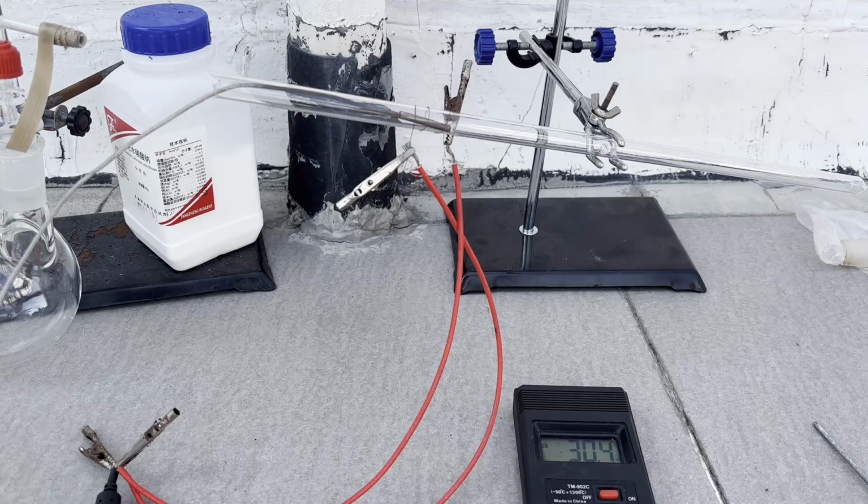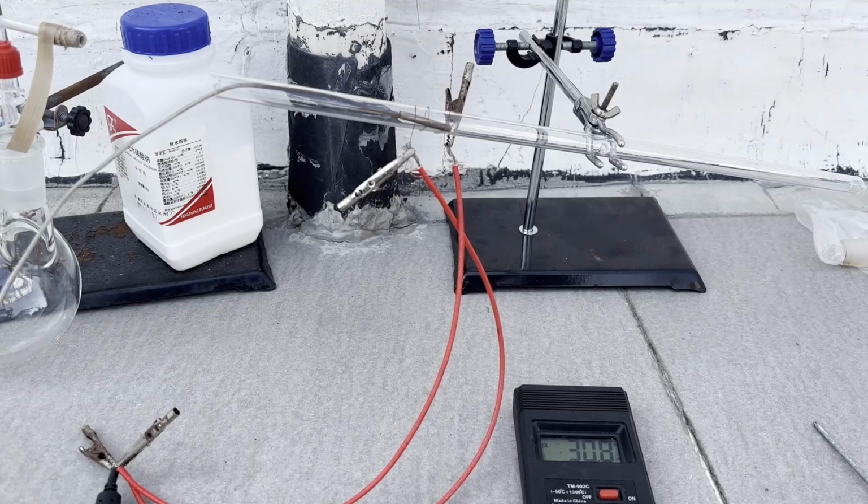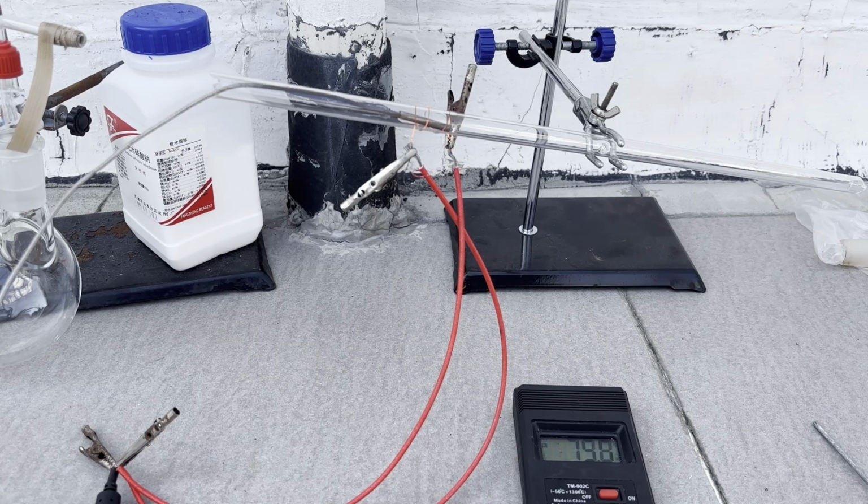With this test of theory done, I designed a much better apparatus using a 500mm long and 10mm diameter transparent quartz tube obtained from an infrared heating element. I first wrapped some nichrome and tested the heating. Since I'm using a 12-volt power supply this time instead of directly connecting to 220 volts like last time, the power is much less than before, and I'm worried that the operating temperature of 400 to 500 degrees C cannot be reached. But I eventually reached 410 C without insulation, and with insulation the temperature could certainly go up beyond 500 C, so we're all good.